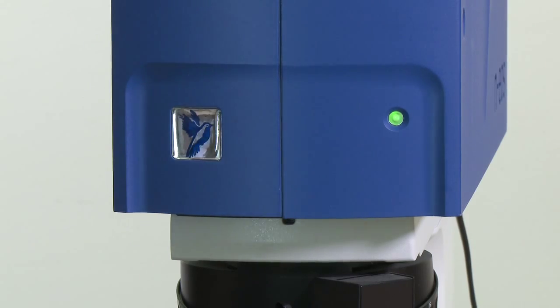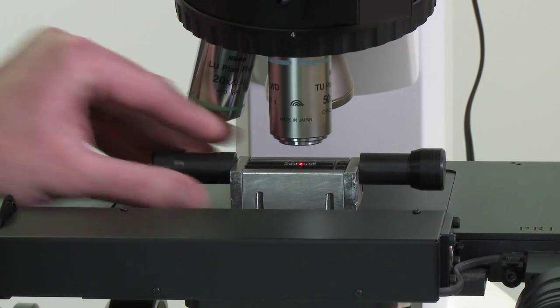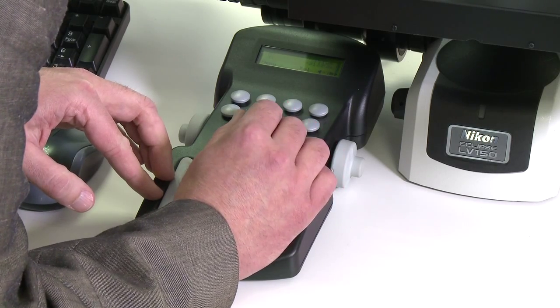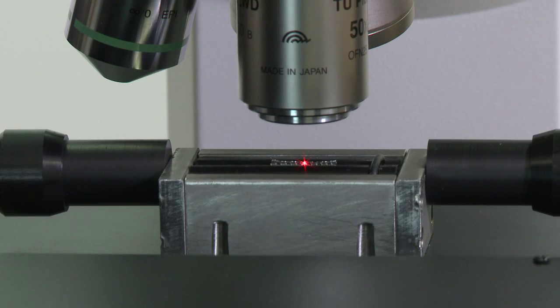There are many types of sample which we could have demonstrated on the n-gauge. In this n-gauge here, I'm focused on a cardiac stent. With a cardiac stent, we can easily get our submicron laser spot focused onto the strut of the stent, and the white light imaging system will help us to locate the laser spot properly and also to check the surface quality of the sample before we start doing our measurement. I'll show you how we can use the n-gauge to align the laser spot on the sample, and then how we can acquire and analyse the data in order to measure the parameters which we want to get.